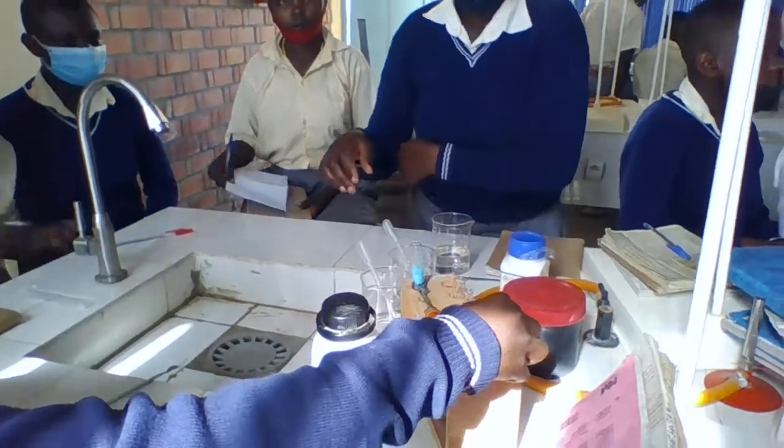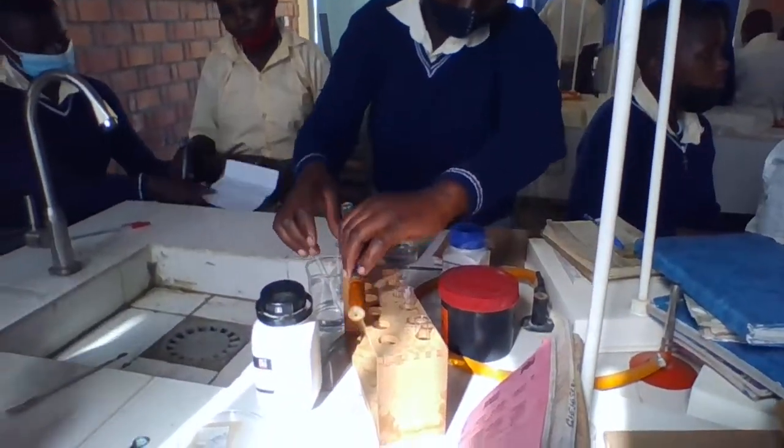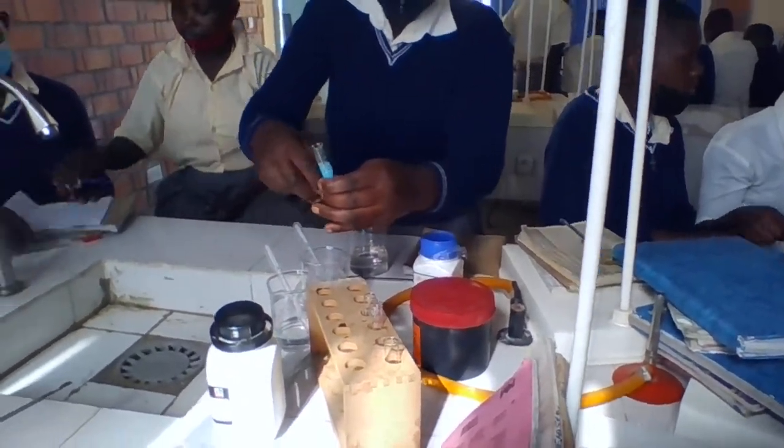I don't want anyone to stop or to stay without acting. You have many test tubes for everyone to work.